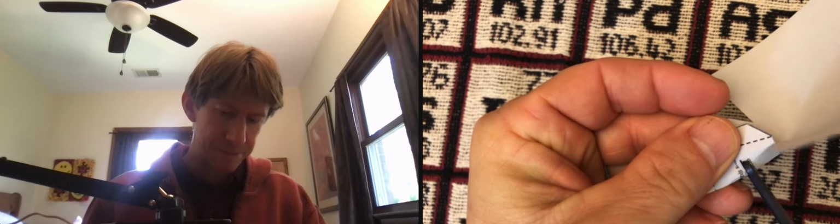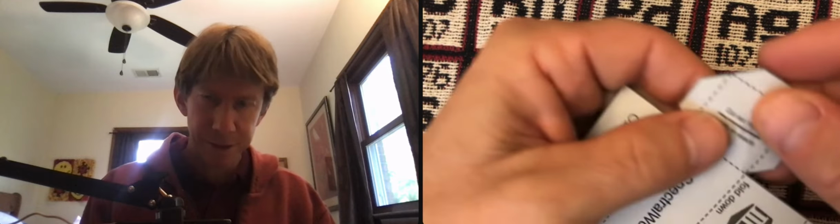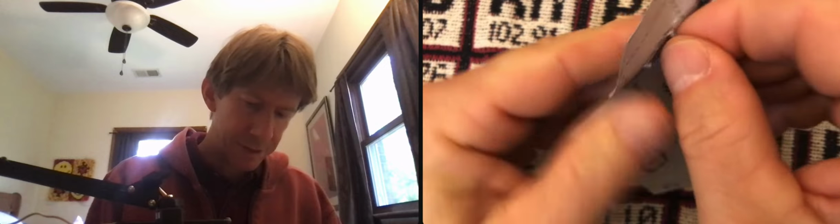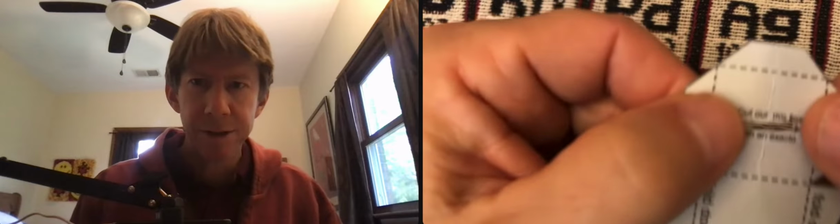I'm gonna fold it actually all the way and hold on to it on this side. I'm gonna make one cut and then I'm gonna make a cut right next to it as close as possible. And then I'm gonna tear that little piece out. So you can see I've got two cuts here right next to each other. I'm just gonna tear that piece out. You can cut it out too. And you can see I've got a little window there. And the thinner the better.